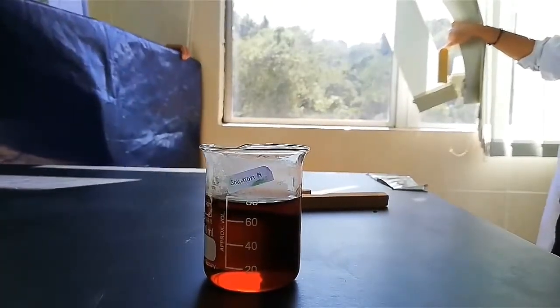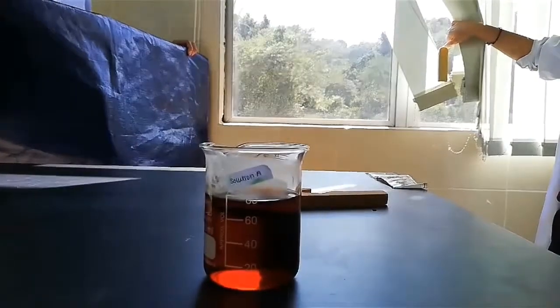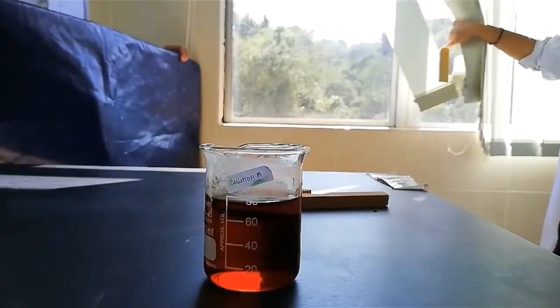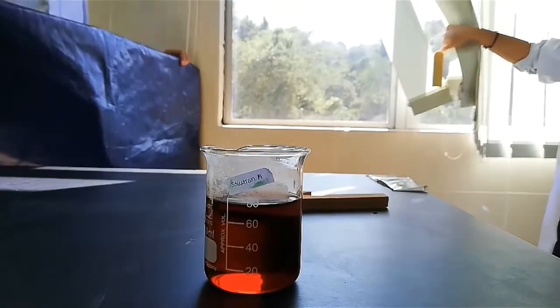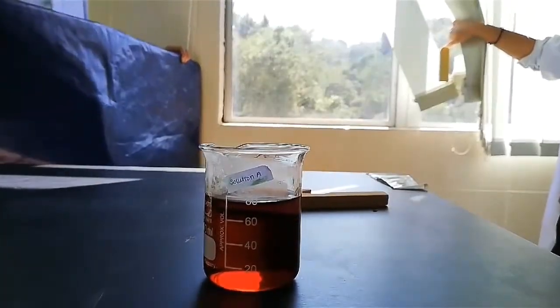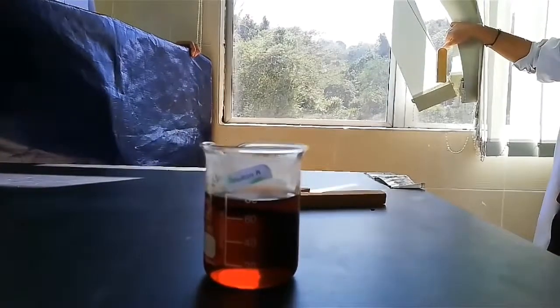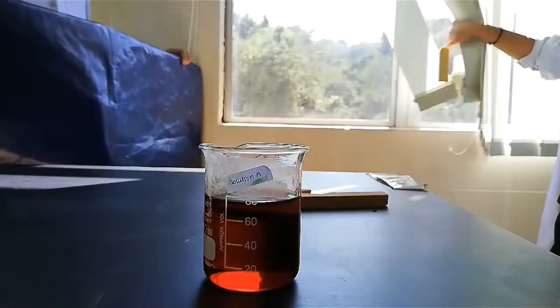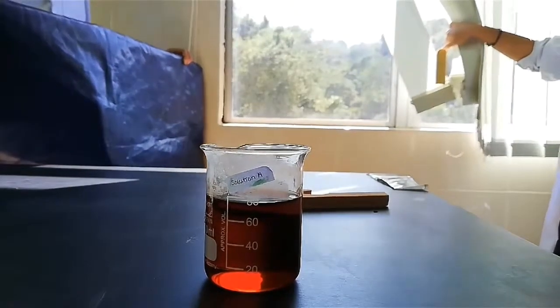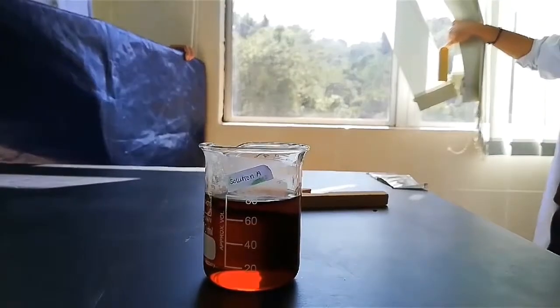The higher the valency of the ion causing coagulation, the higher the coagulating power of an electrolyte. The sulfate ion is more electronegative than the chloride ion. Thus, the sulfate ion can donate more negative charge or electrons to the positive charge of solution A, which causes the solution to accumulate. The accumulated charge in solution A will coagulate and form a precipitate.